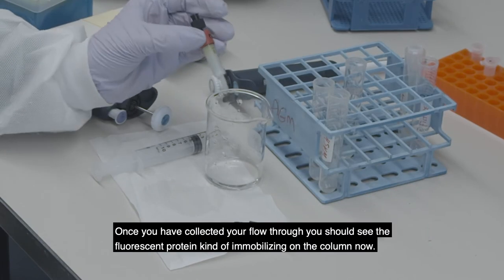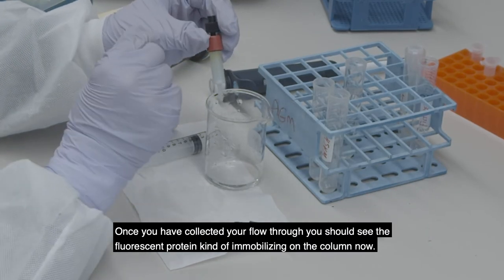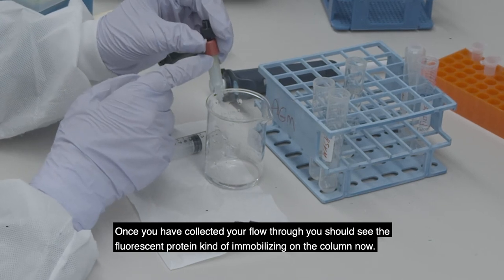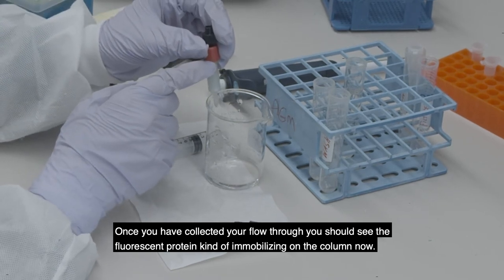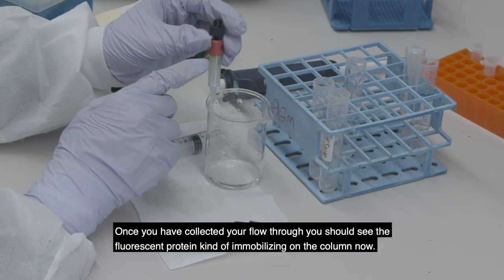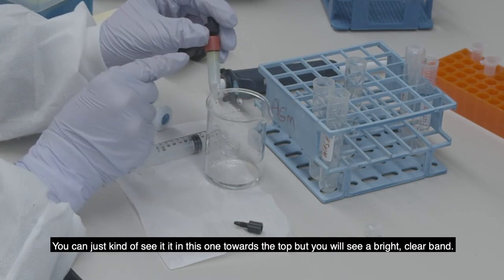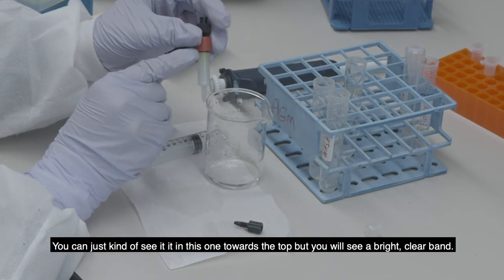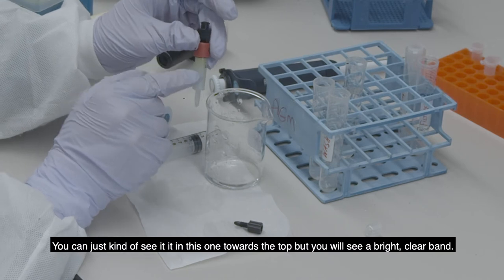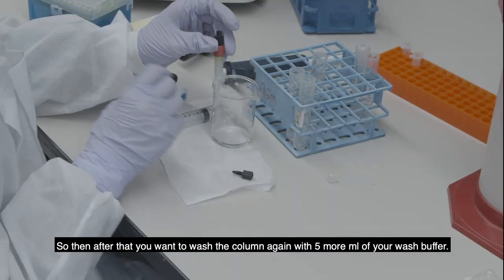Once you have collected your flow-through, you should see the fluorescent protein immobilizing on the column. You can just see it towards the top — you'll see a bright, clear band.